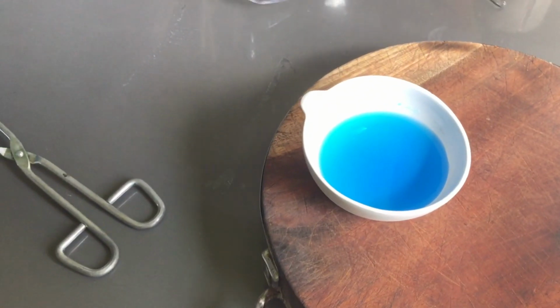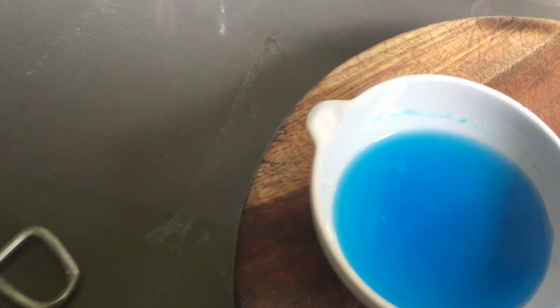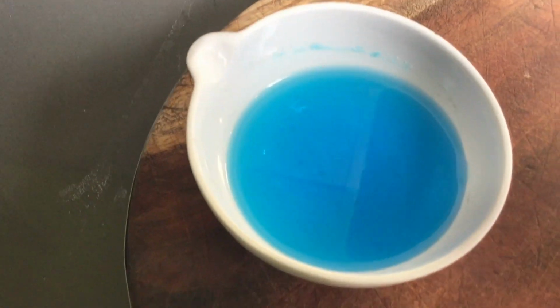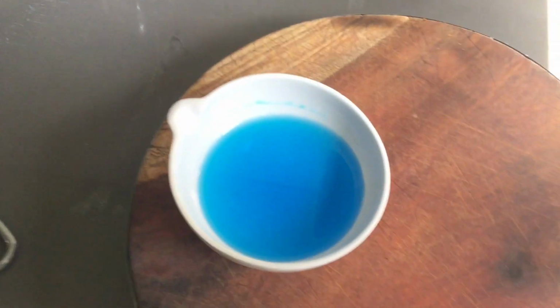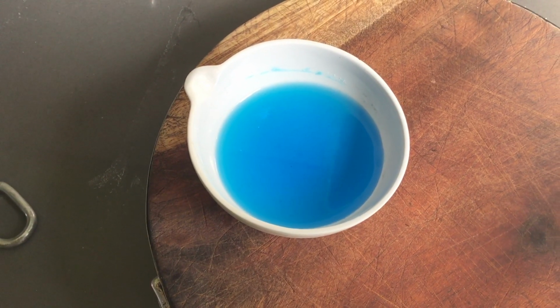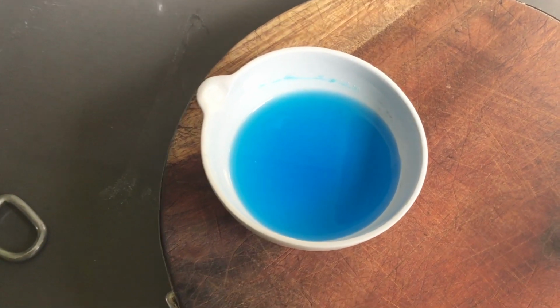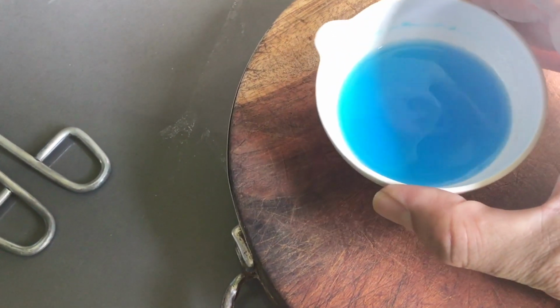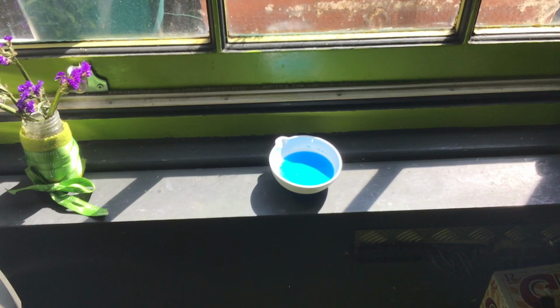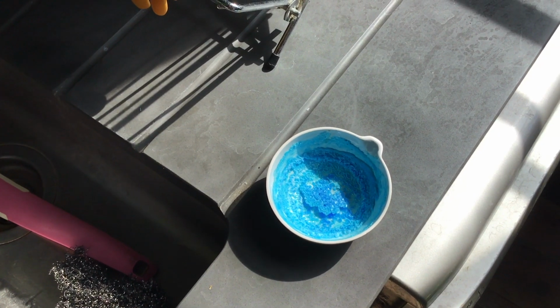Well, I've heated this up in the water bath now, and you can see some crystals on the side there. You can see that rim of blue around the edge of the copper sulfate, just in there, and that's all you need really. You just need some crystals to form, and then you'll get better crystallization when you leave it on the windowsill. So I'm going to pop it over on the windowsill now, and there we go, nice sunny spot on the windowsill, and we'll leave that there for a couple of days and see what our crystals look like. And here we go, here's our lovely copper sulfate crystals.